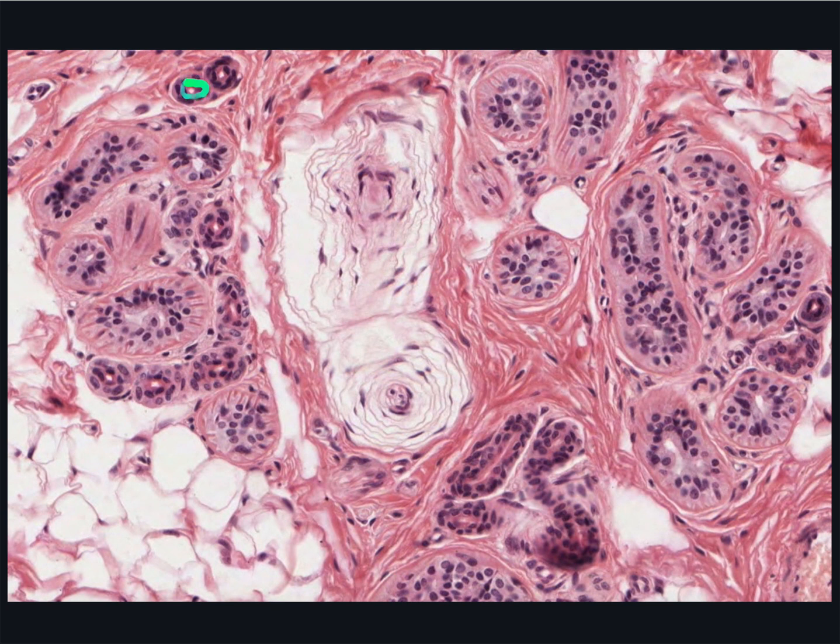The secretory portion of the gland is lined with a pseudo-stratified layer of plump cuboidal or pyramidal shaped cells. They're lightly stained and have large prominent nuclei. Myoepithelial cells can be seen wrapping around the secretory cells.